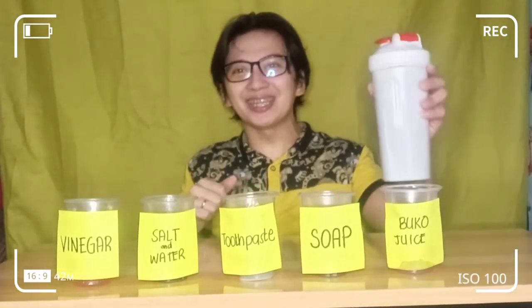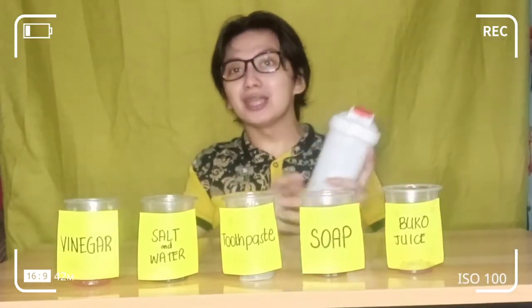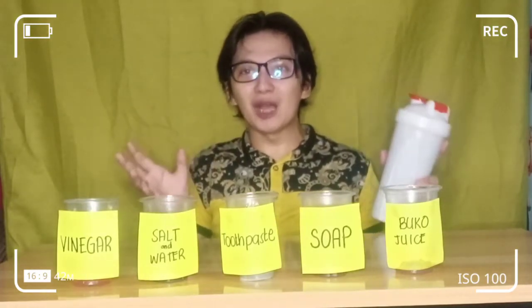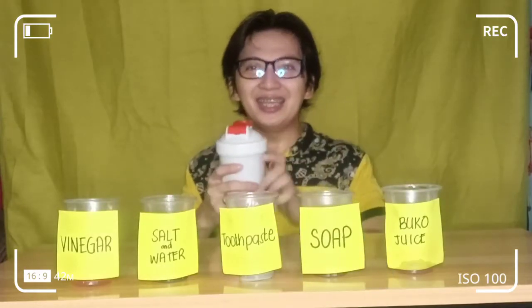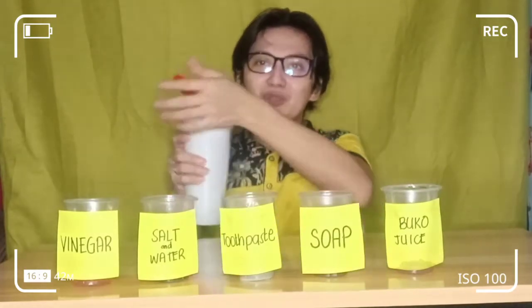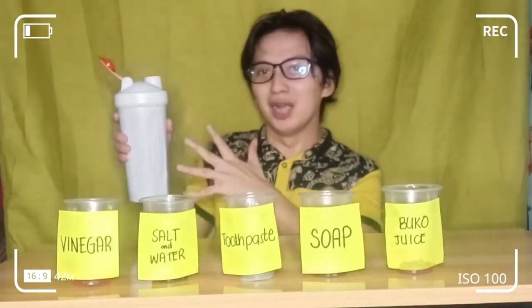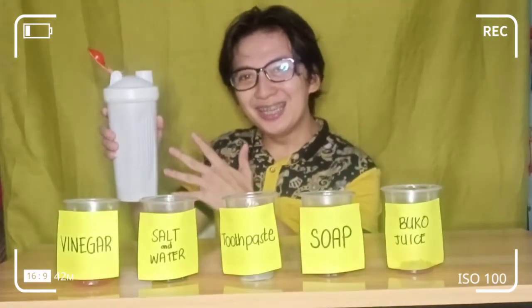And here is our magic tumbler. By the way, this is not a magic show — this is a scientific way of how we identify substances. First, we need to open up our magical tumbler with our red kamote tops extract.